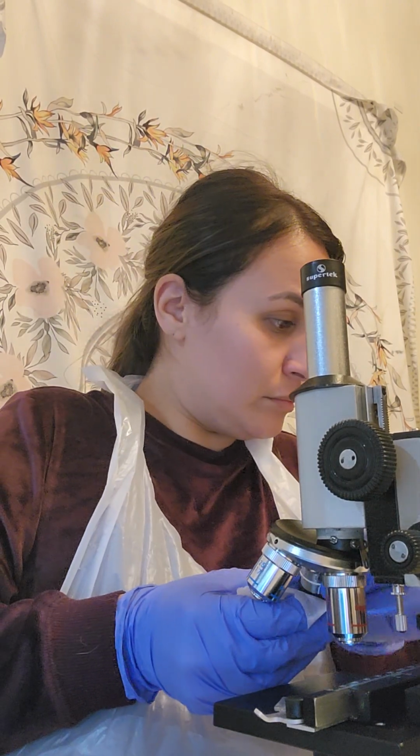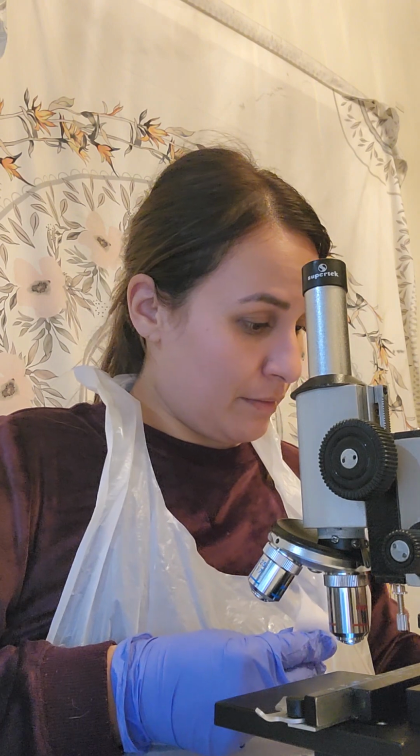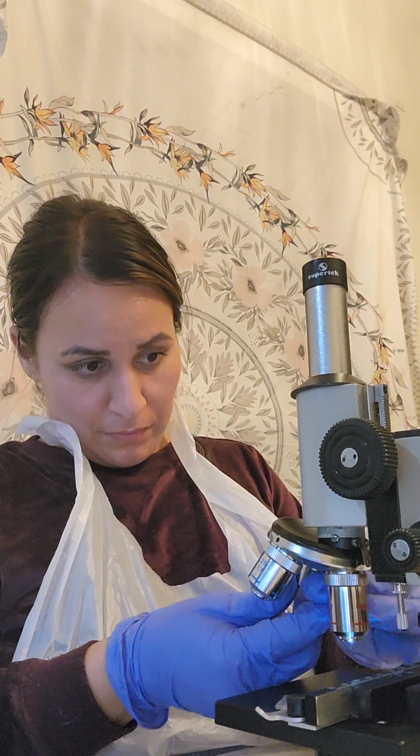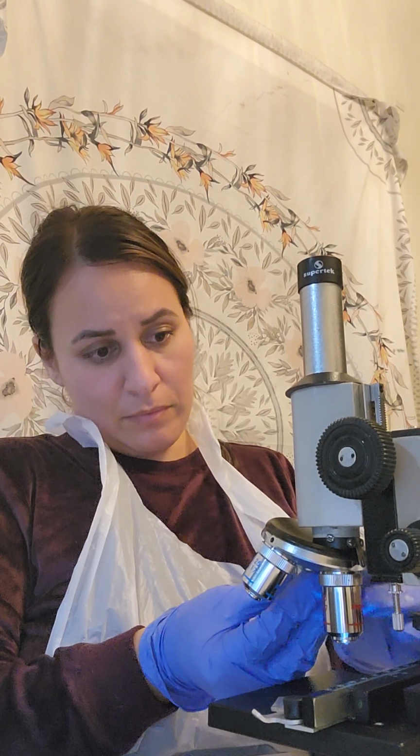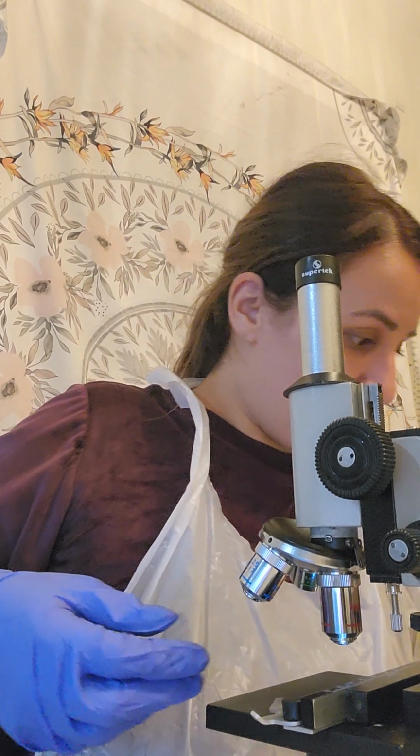And we're moving on to the yeast whole mount.